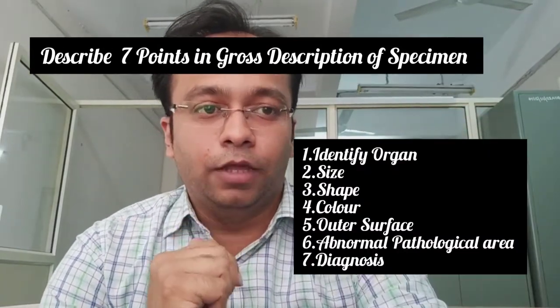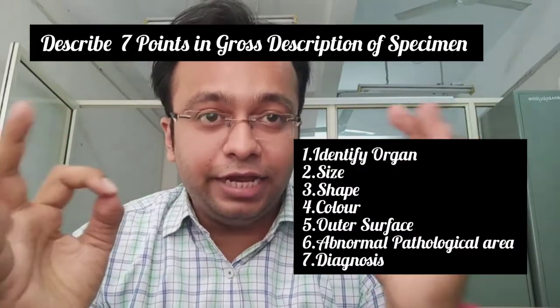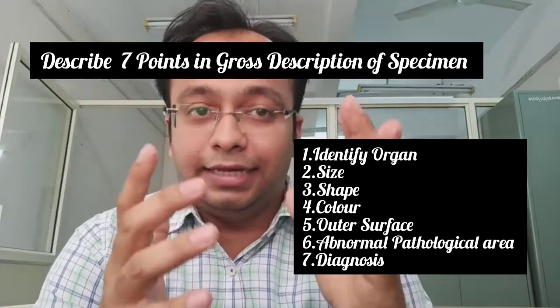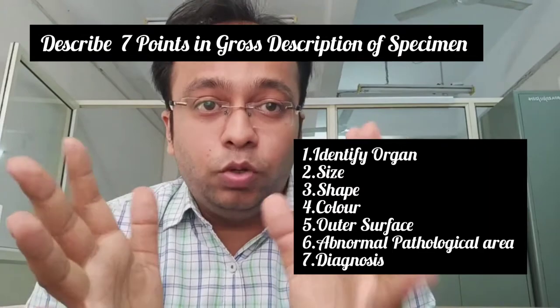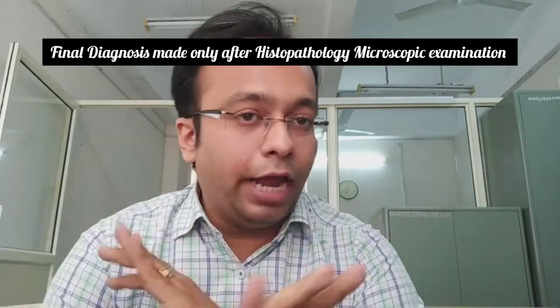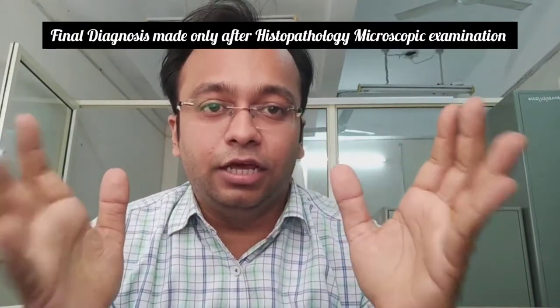You have to describe the specimen in a seven-point manner. You have to tell the provisional diagnosis only at the last, because the diagnosis will be confirmed only after histopathological microscopic examination. With gross examination alone, you cannot tell one hundred percent about the diagnosis.